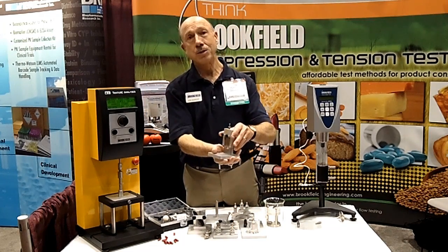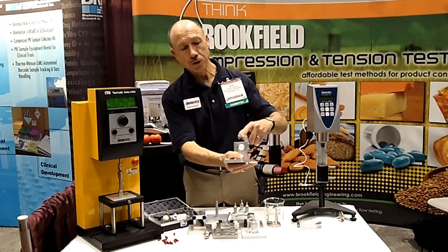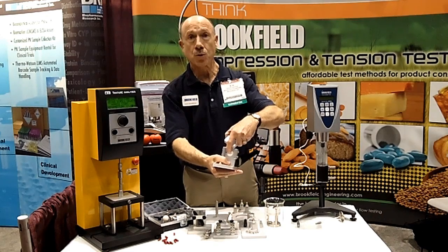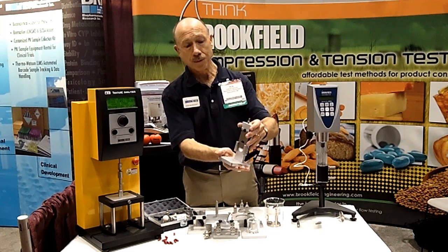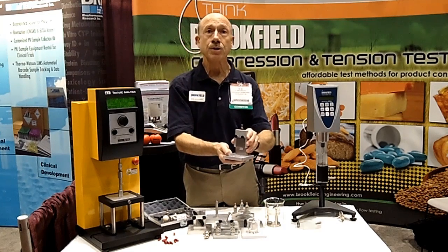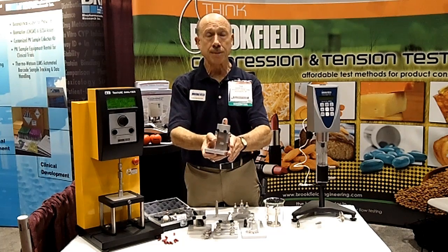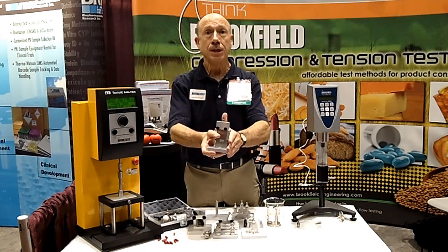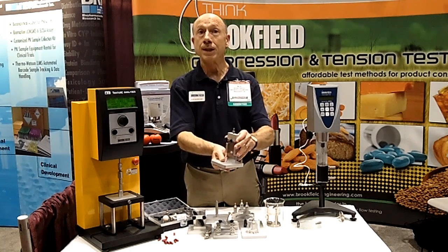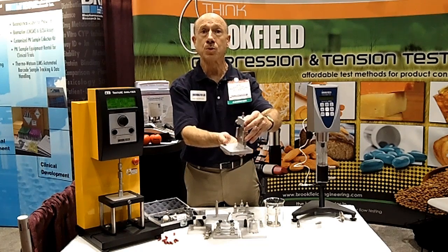This particular mechanism is called a bilayer shear test device. I can put a two-part tablet into this holder, and then come down with a blade to physically cut it in half. What I'm trying to do is measure the adhesive strength between the two parts of the capsule. When they make those capsules, they press them together, and they want to make sure those two halves will hold together. This bilayer shear mechanism measures the bonding strength between those two halves.